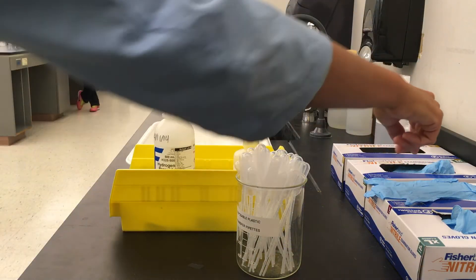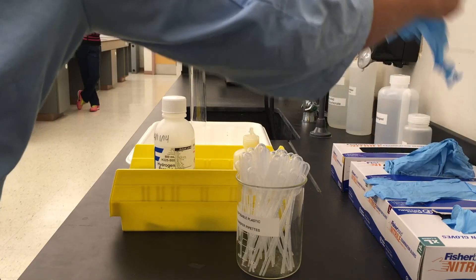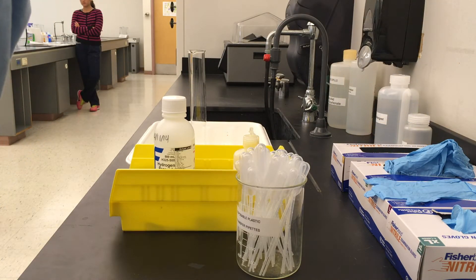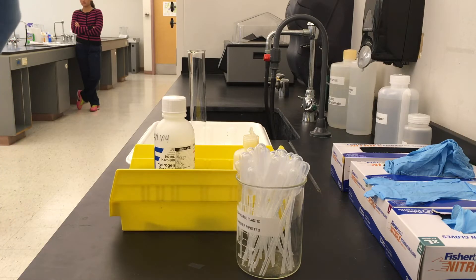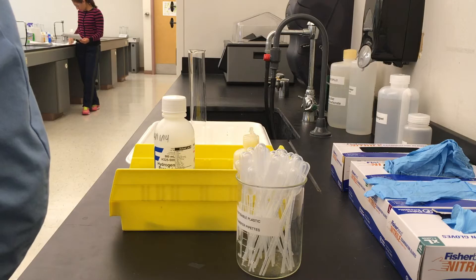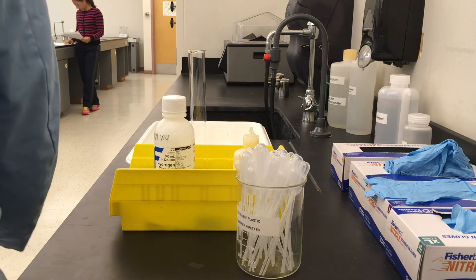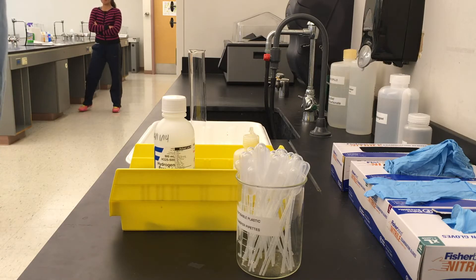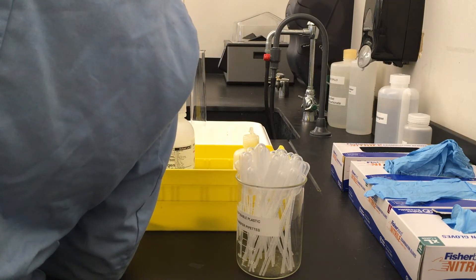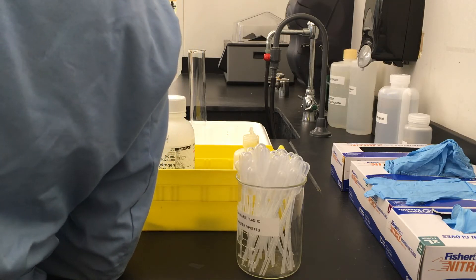To begin, I'm going to put some hydrogen peroxide into a graduated cylinder. If you feel the bottom of the cylinder, the hydrogen peroxide will feel cool to the touch.